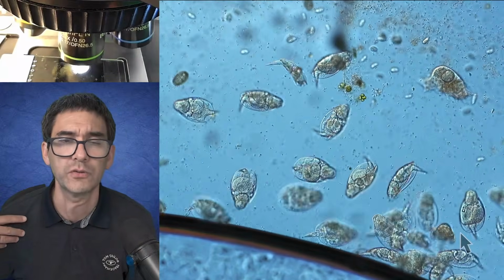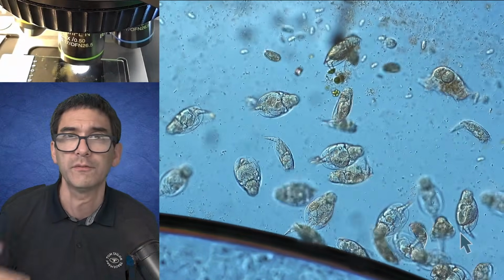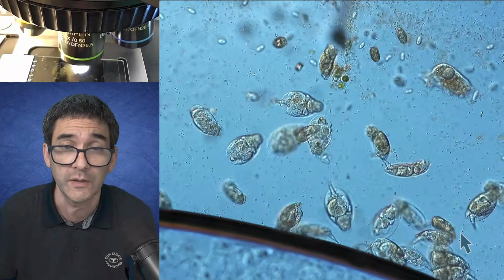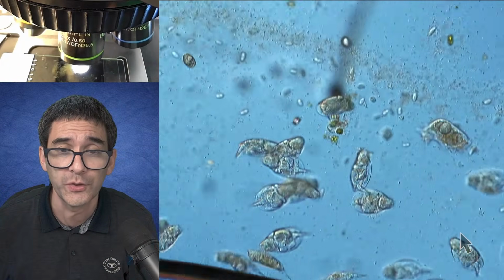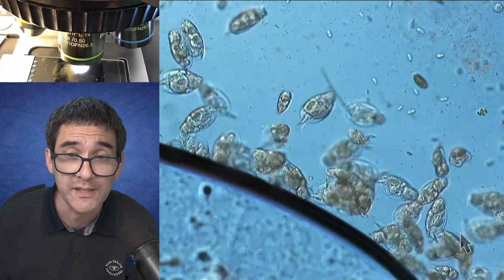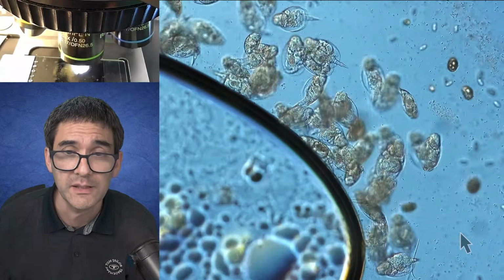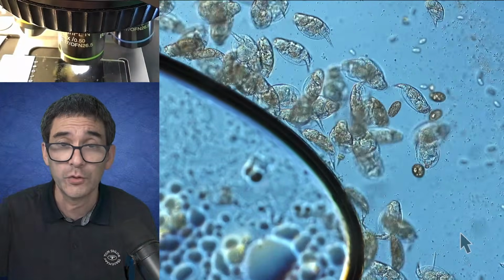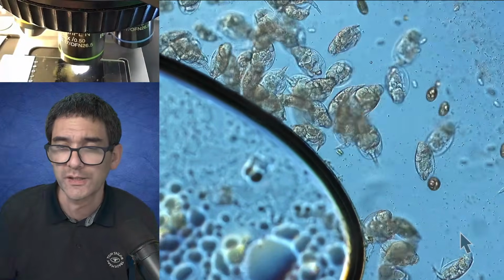For example, humans are not eutelic. Different human beings have different numbers of cells. If you're larger, you have more cells. If you're smaller, you have fewer cells, obviously, right? But with those rotifers and other microanimals, also, for example, tardigrades, they're eutelic, and this basically means that it's possible, and scientists have done that, to trace every individual cell back to the first original cell.